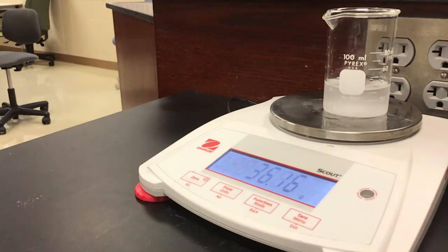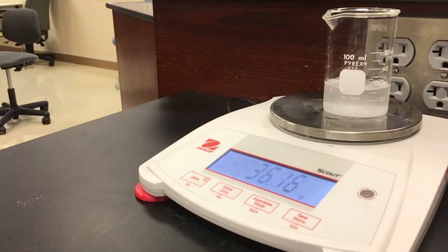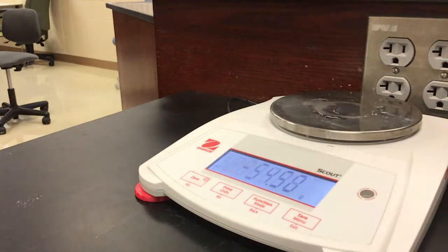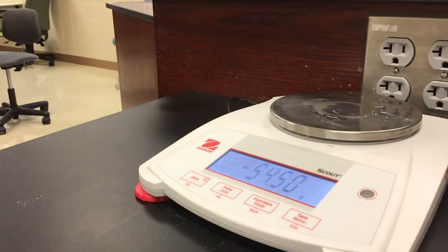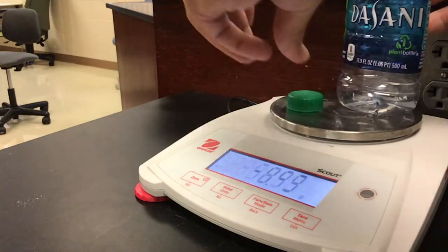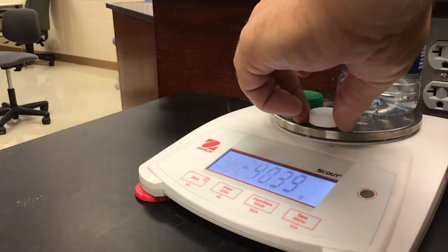Use the information gathered to answer the questions. Our next lab is: does gas have mass? So I have this bottle, a lid, and two Alka-Seltzer tablets right here.